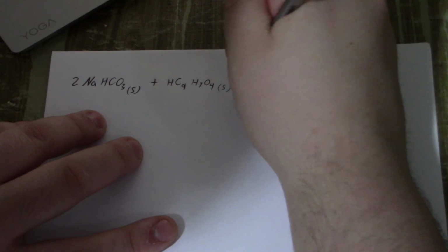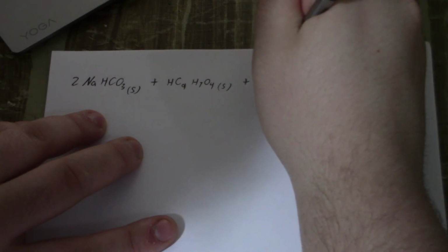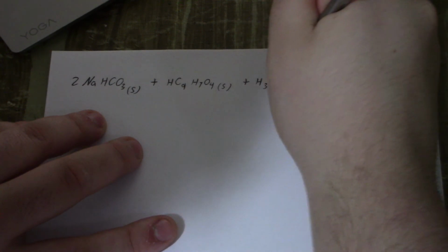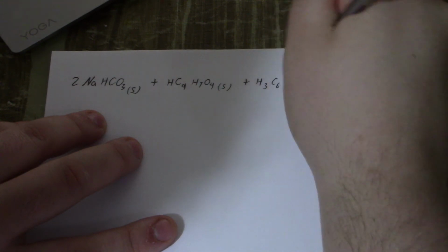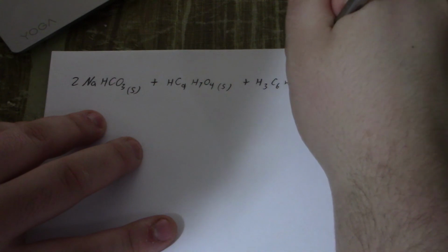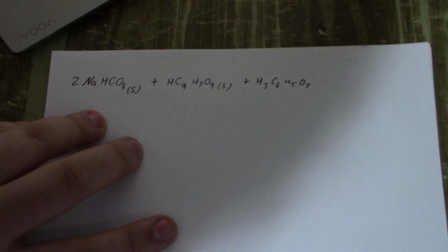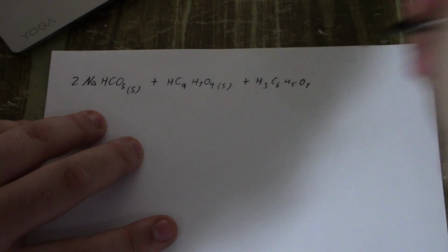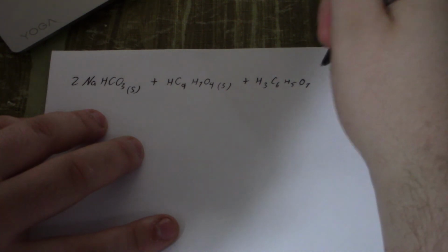And then we have our citric acid. Citric acid being one of the main components of all of our favorite citrus fruits. It's what that tanginess and that acidity that we love from oranges and lemons all comes from, that citric acid. Very good for you too. It's also a very good preserver. If you want to preserve things, put some citric acid in it.